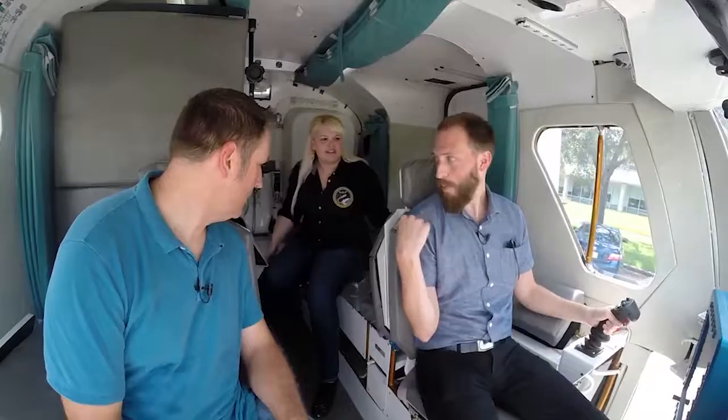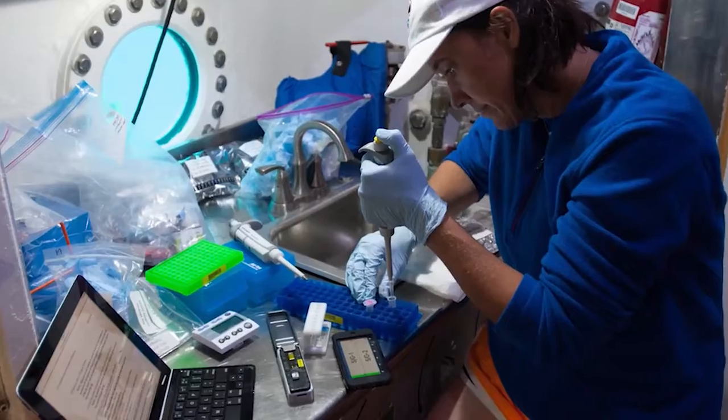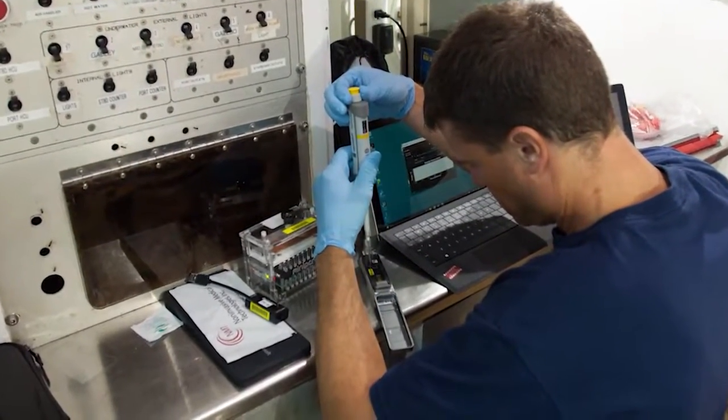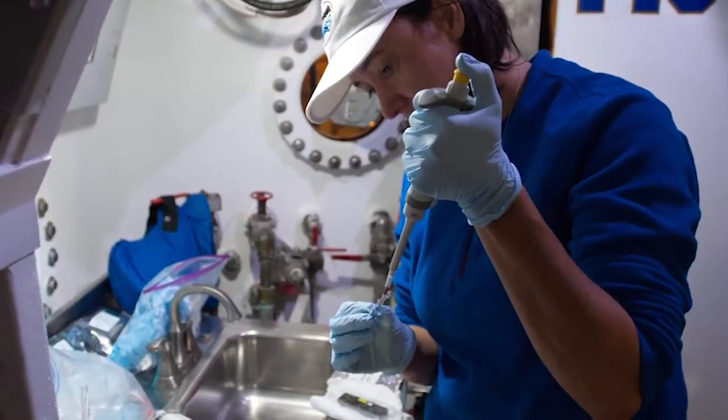So we got the sequencer in here with us. Has that one been used before? Have you used it anywhere as cool as the rover yet? Almost as cool. This one was used in the Aquarius habitat as part of the Nemo mission that's about 62 feet at the bottom of the ocean off the coast of Key Largo, Florida. Oh, wow. So we had the aquanauts last July collect samples from their habitat, prepare those samples for sequencing, and then sequence what they found.